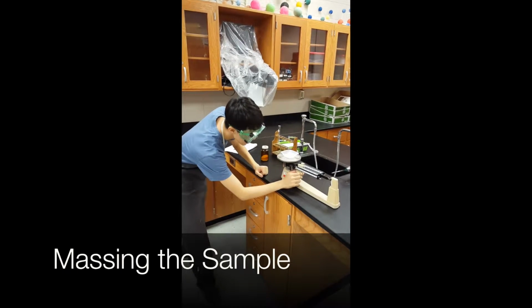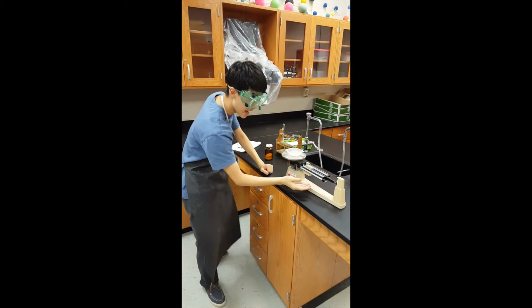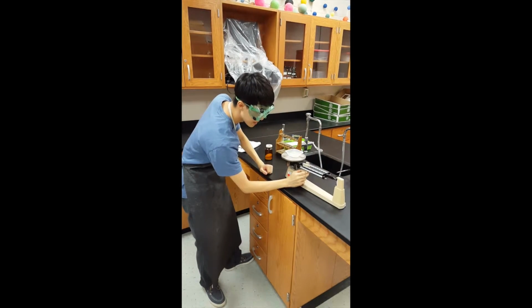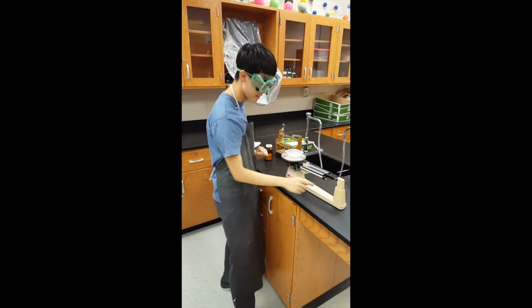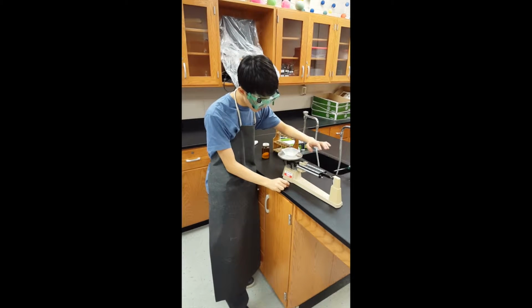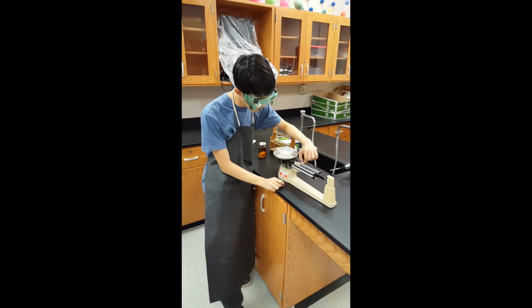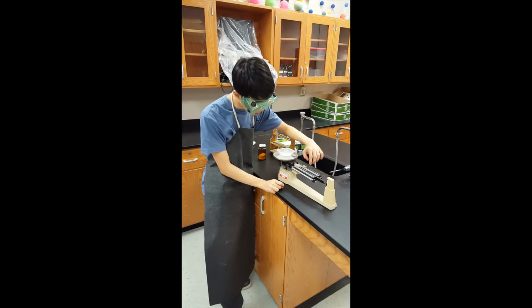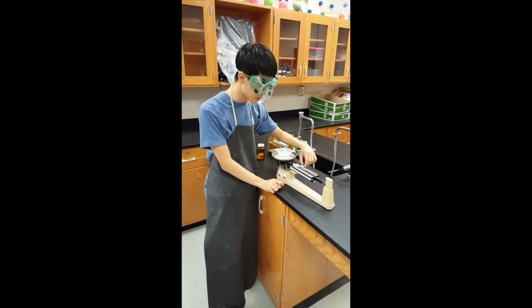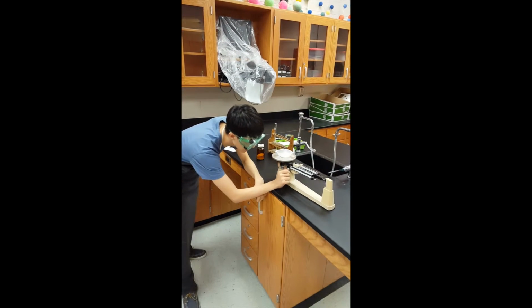You want to move the biggest increment first, which is the 100-gram increment. And if it sinks down like this, you know you went too far and you must move it back to the previous increment. Next, you move the 10-gram increments. So 10, 20, 30. Oh, it sank back, so you must move it back to the previous increment. All right, so 20. Now you move the 1-gram increments.